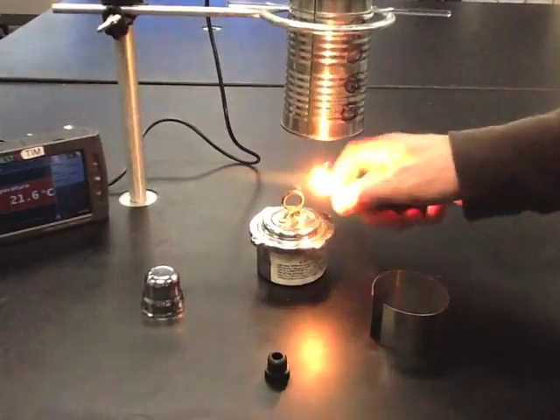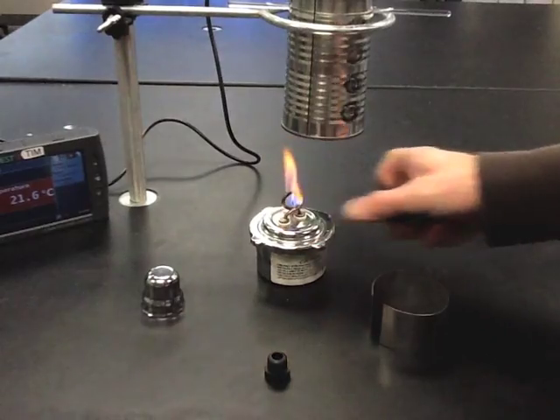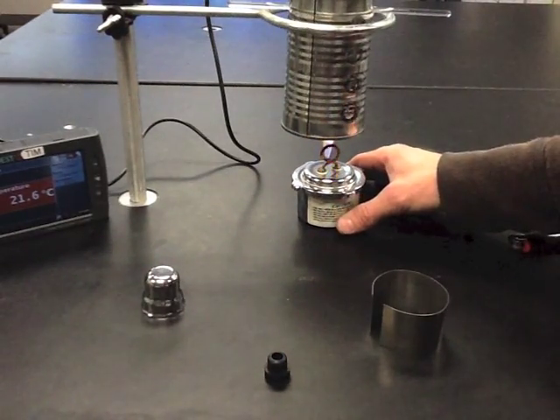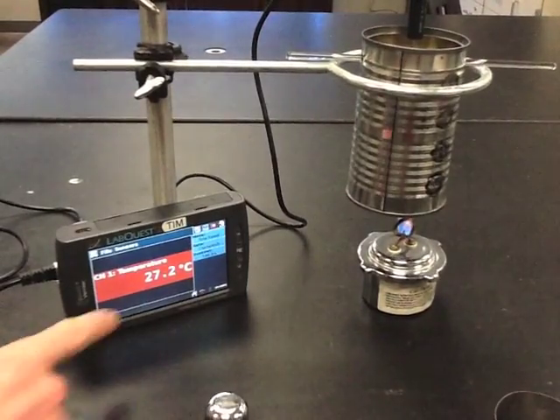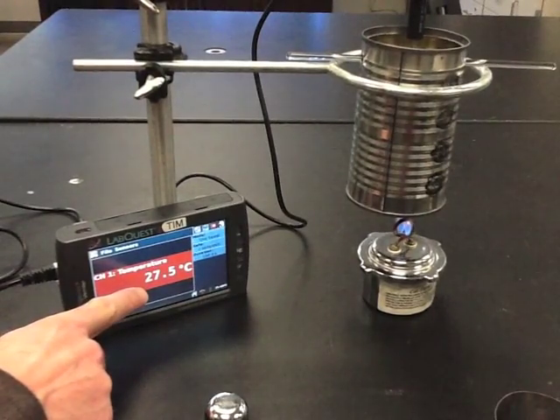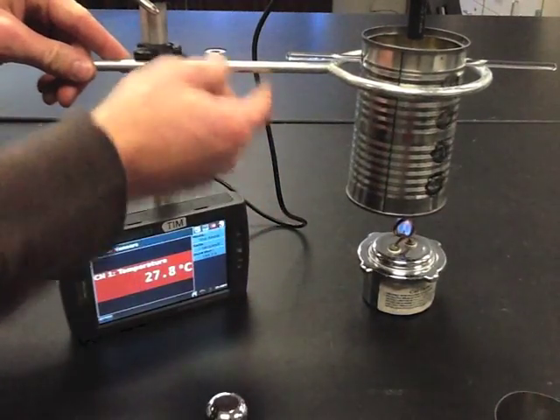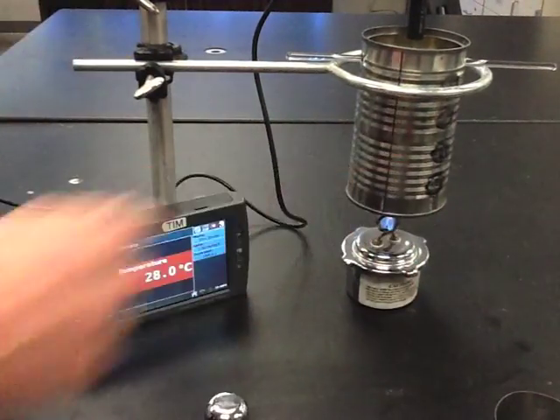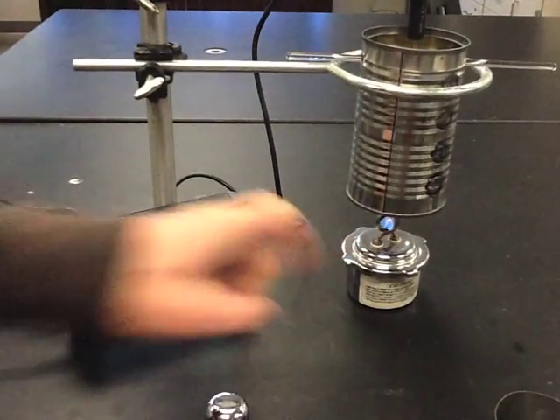When you're all set to go, go ahead and light your alcohol burner and place it underneath your water. Keep an eye on your temperature as the experiment runs. When it gets to about 45 degrees, stop. Make sure that your flame is making best contact with your can — make sure the height is appropriate and that the can is as close as it can get to the flame.